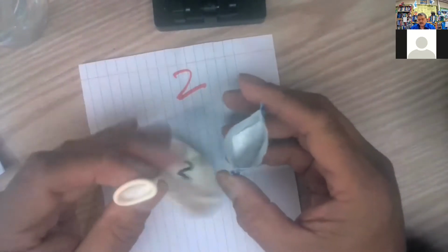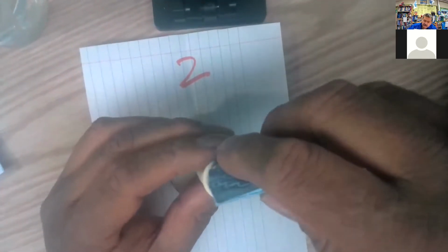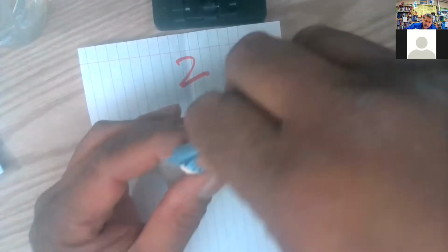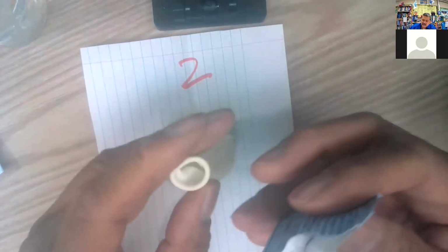And just like I did on the first one, I'm going to put some air in there to blow that up a little bit, make it a little more round and make it easier for us to pour the powder in. Here we go. Starts it up a little bit. Now I got a hole to work with. So let's pour that stuff in. And if I miss, no big deal. I have the paper underneath. And I'll take it off the paper. Then I'm going to try not to miss. We'll see once I say that.